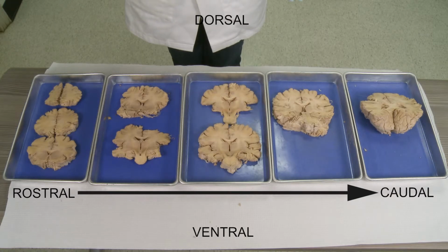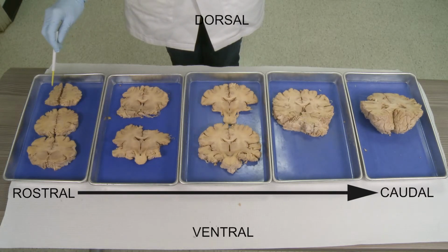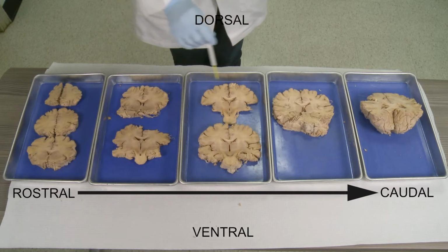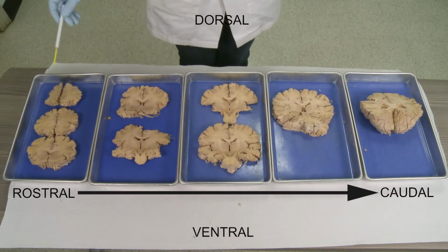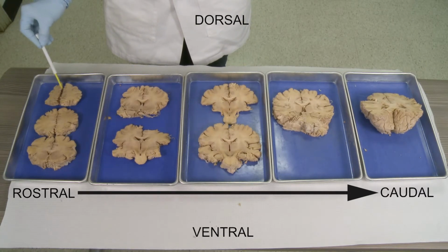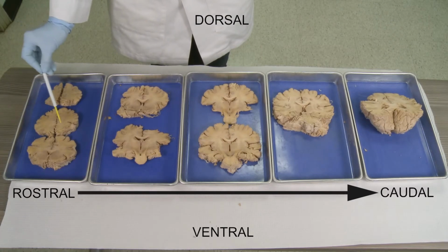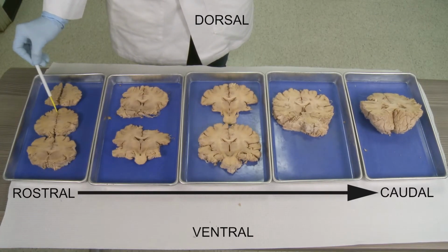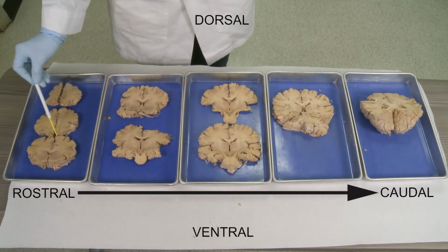So this final view shows the series of sections I made through this dissection movie, starting from the anterior or frontal and going back to the caudal or posterior. To review, when you cut the brain in the rostral part, you will see gray matter, white matter, and start seeing the corpus callosum, the connection between the two hemispheres, which becomes bigger as you progress toward the caudal part.